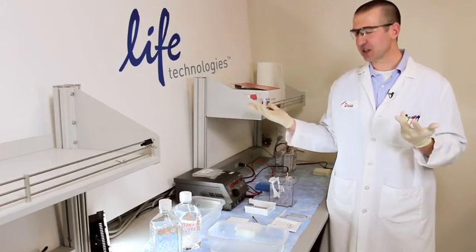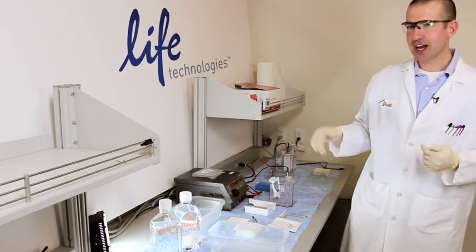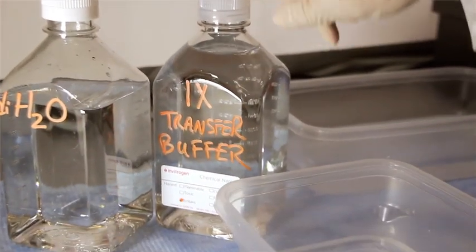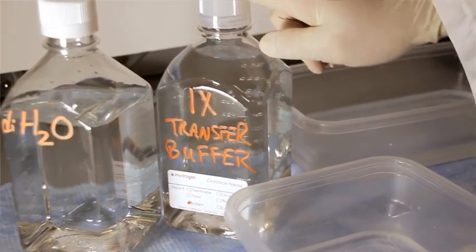Okay, so to get started, let's talk about the things we need here. First of all, we've got our deionized water. We've got our transfer buffer that's already made up into the appropriate formulation.